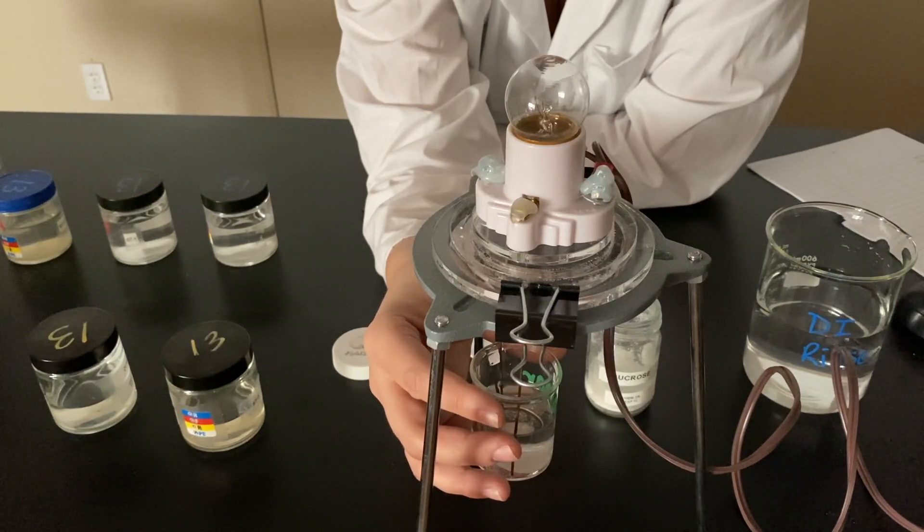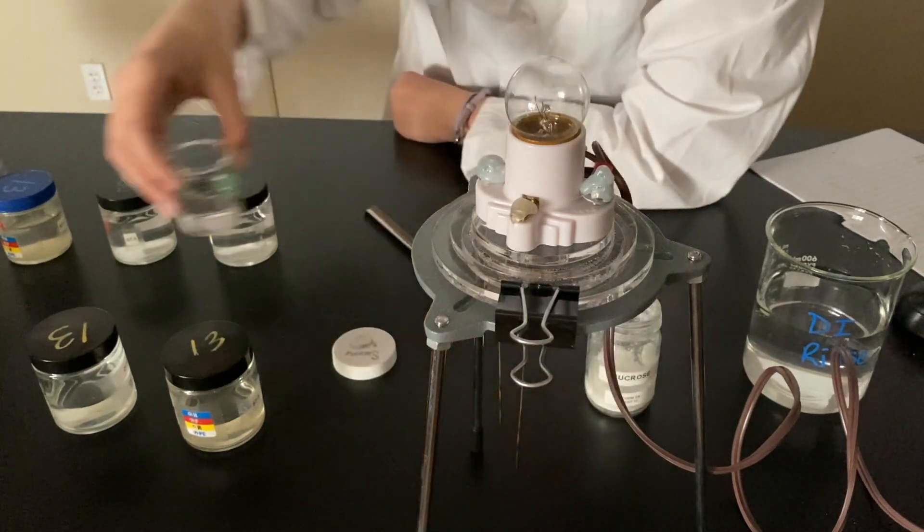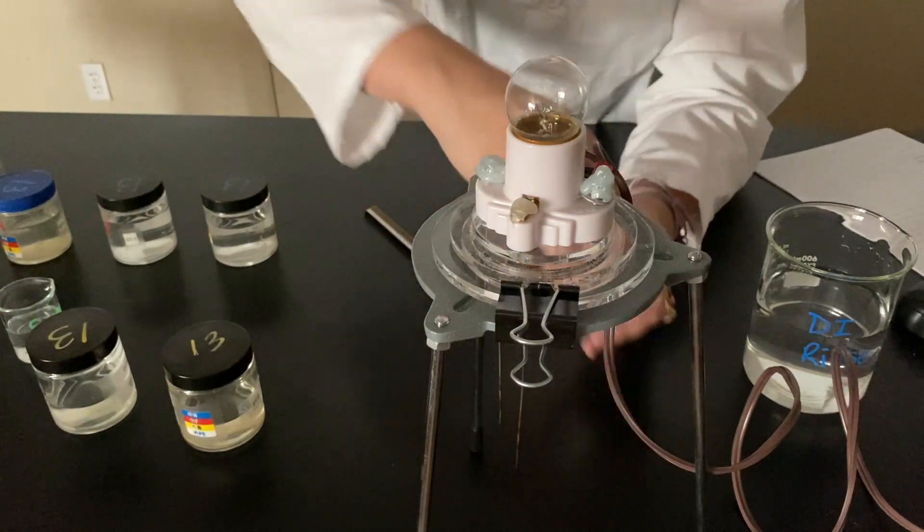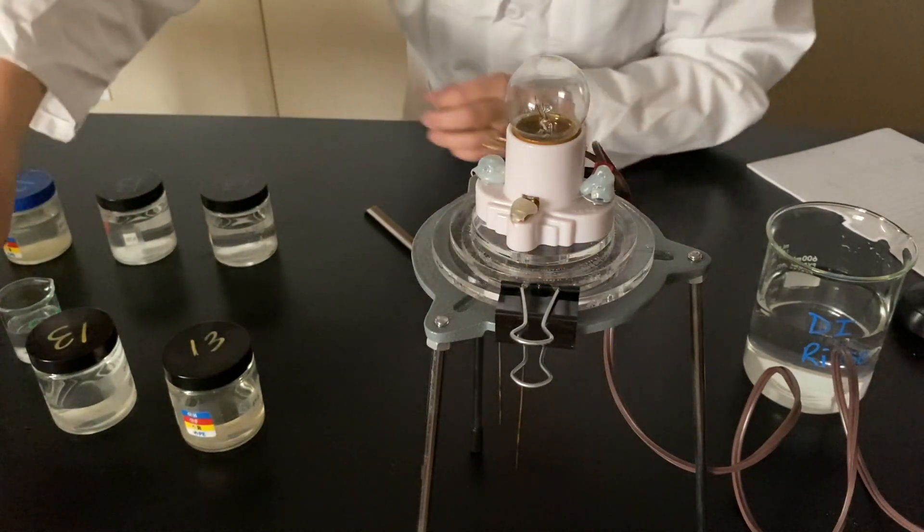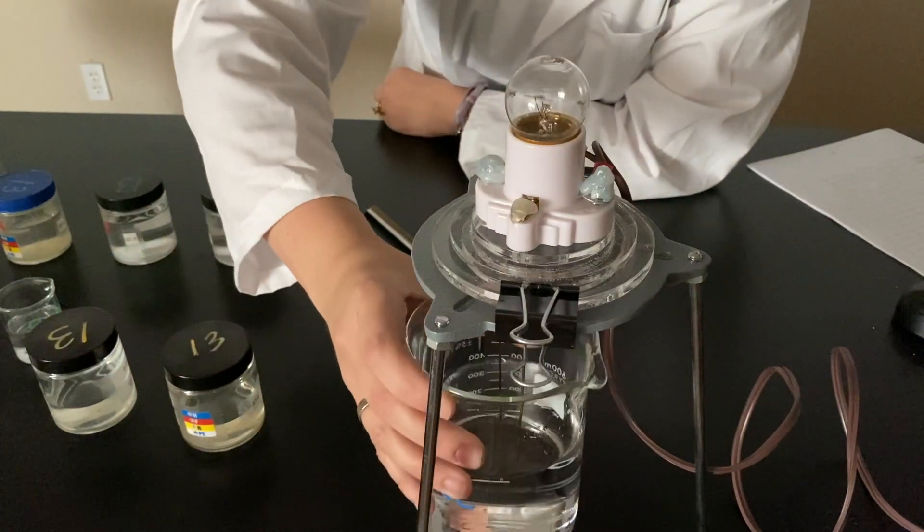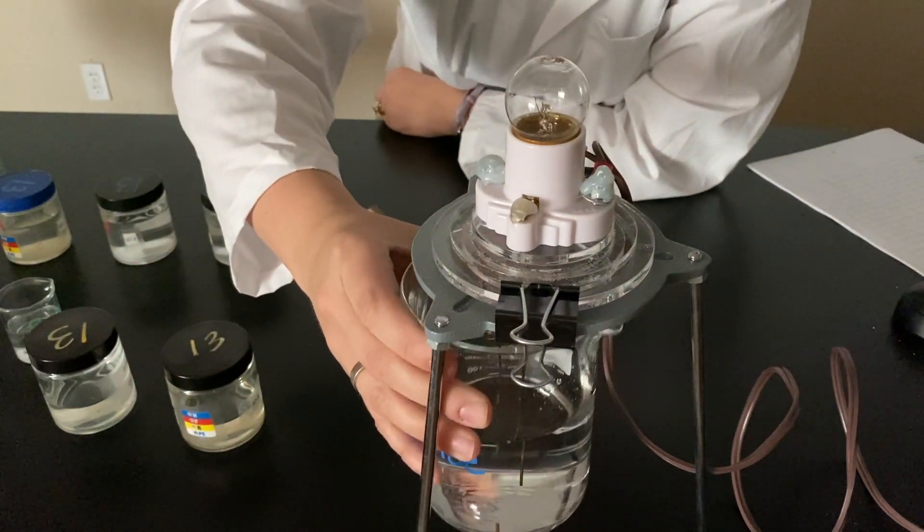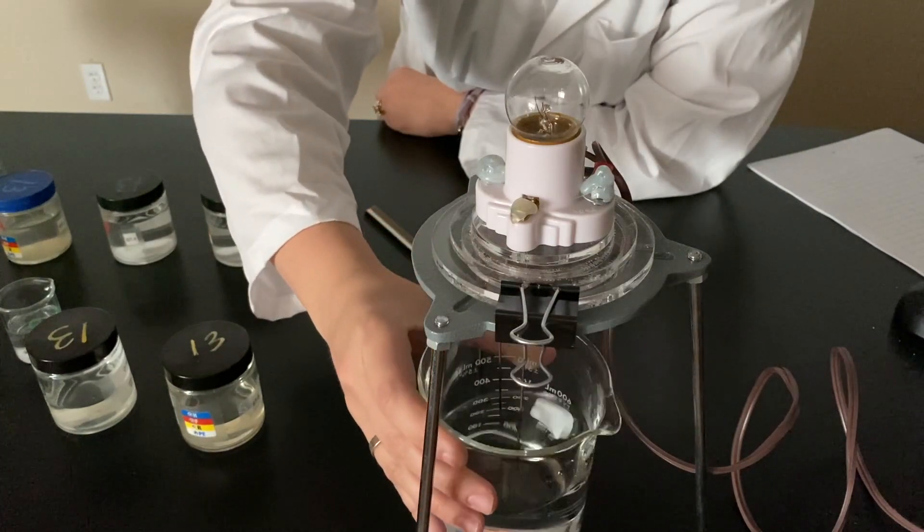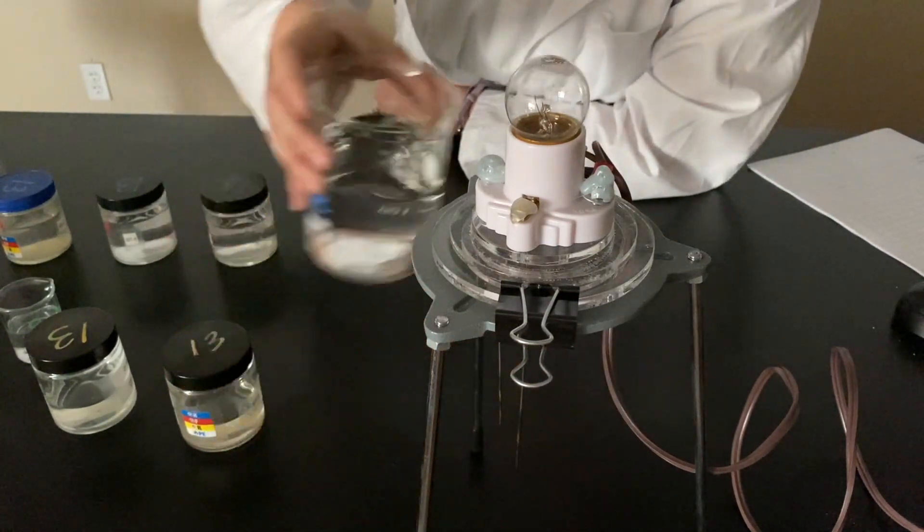Interesting. So that's sugar water, or sugar aqueous. We'll rinse it off with our DI solution here.